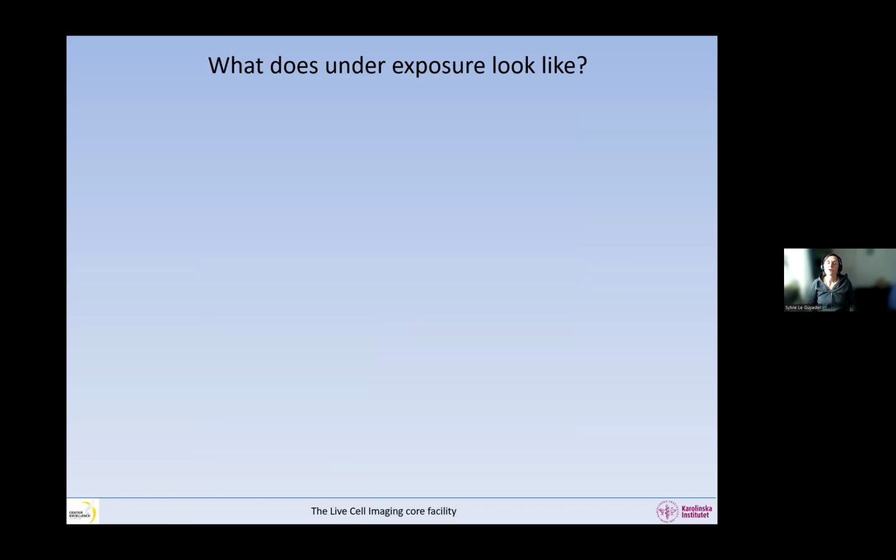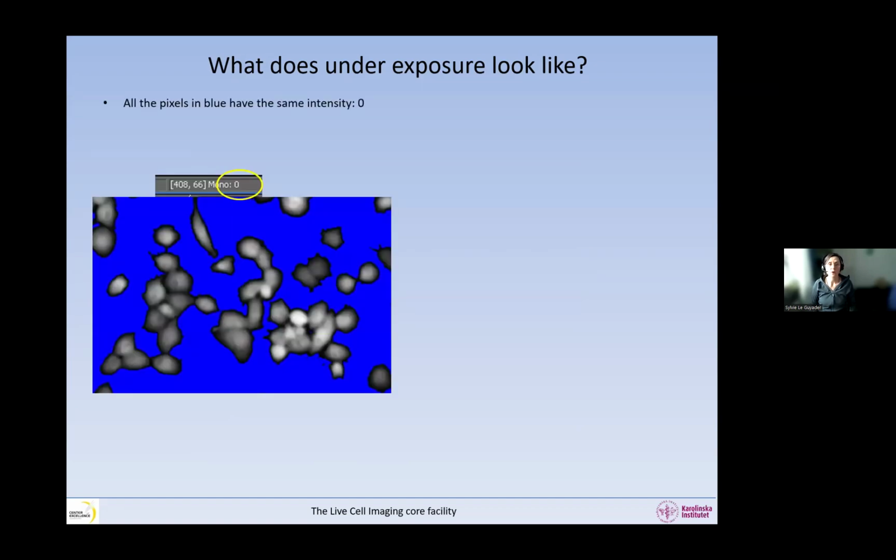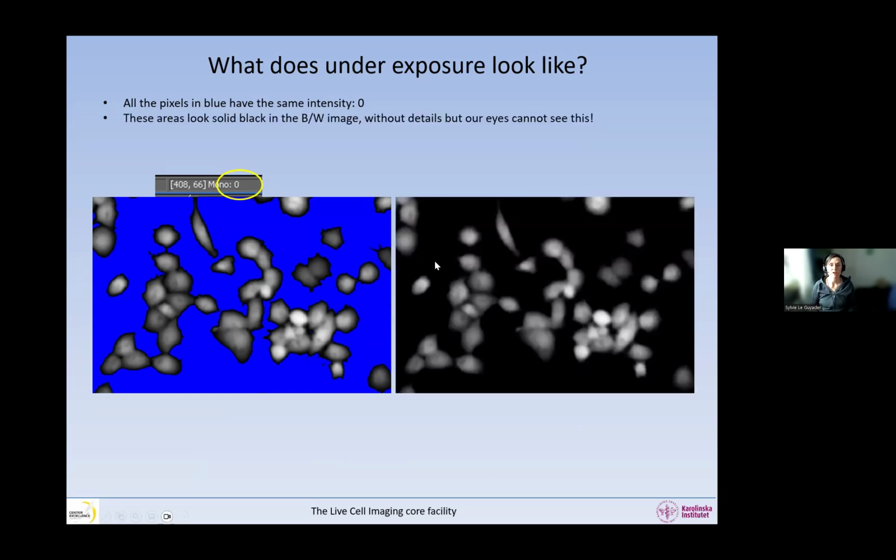So what does underexposure look like now? Instead of saturation, we also have underexposure. Well, all the pixels in blue. So we have also applied this mask that shows us underexposure and saturation. All these pixels in blue have the intensity of 0, which, if you think about the sample, is pretty much not possible. So it's artificial.